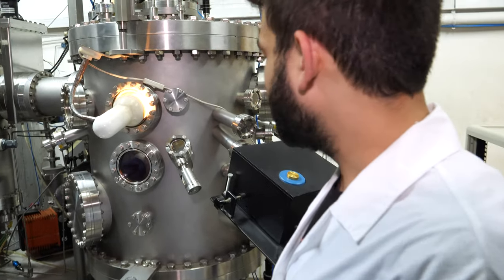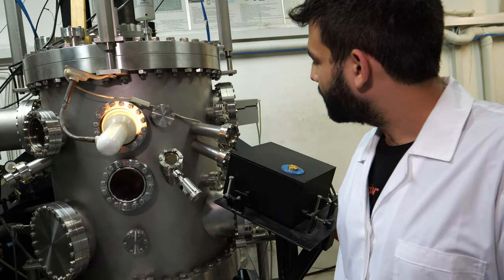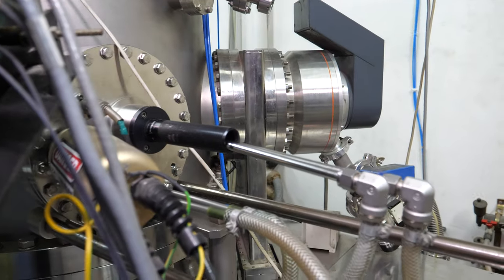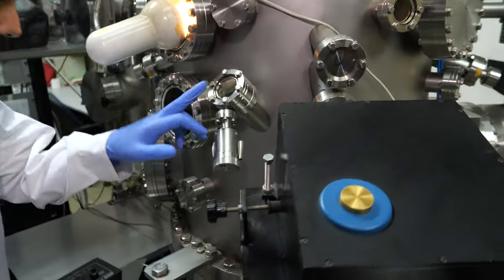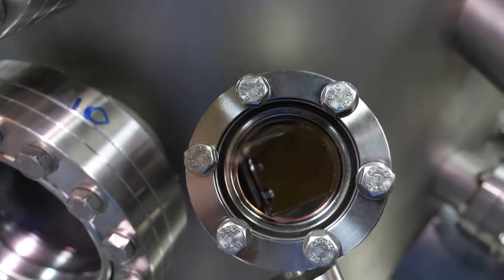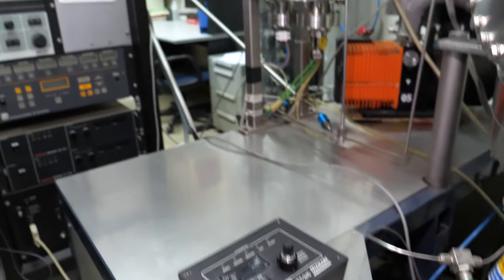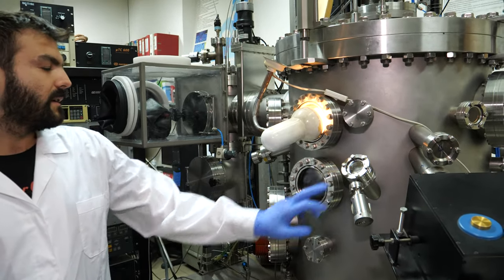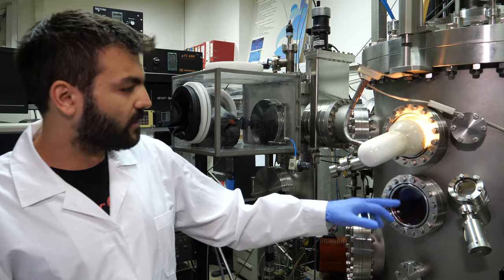In particular we deposit metal layers like silver or gold. Here we put the sources — the crucibles. We adjust the voltage and the current to create the e-beam, the electronic beam, which is focused on these sources. The material is evaporated and deposited on the substrate.